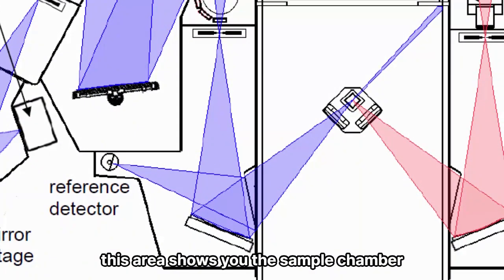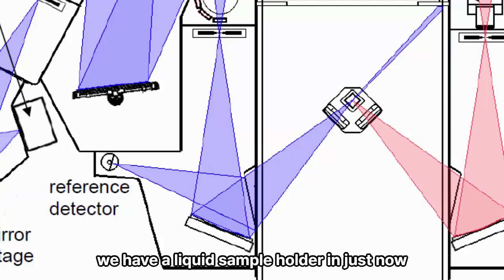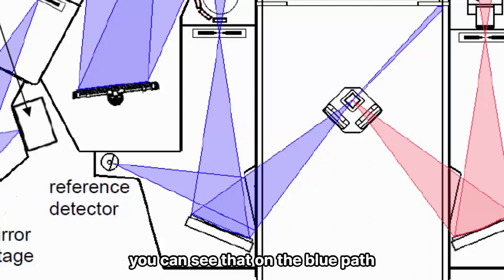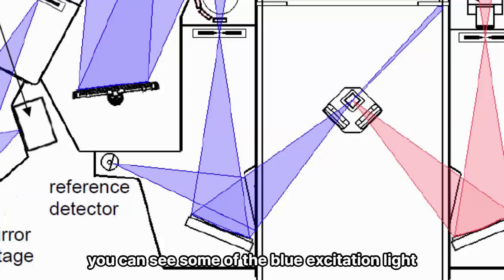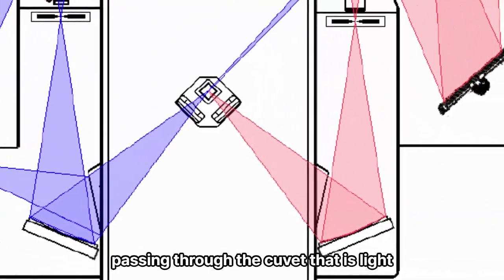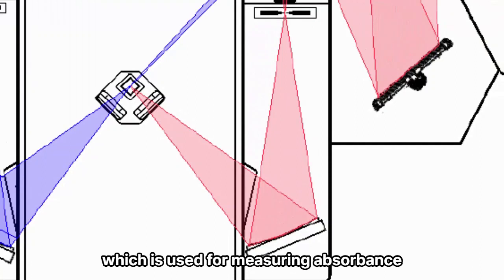This area shows you the sample chamber and the optics around the sample chamber. You can see we have a liquid sample holder in just now with a cuvette inside. You can see that on the blue path you have a reference detector which is used for correcting the excitation spectra. You can see some of the blue excitation light passing through the cuvette. That is light which hits the transmission detector, which is used for measuring absorbance.